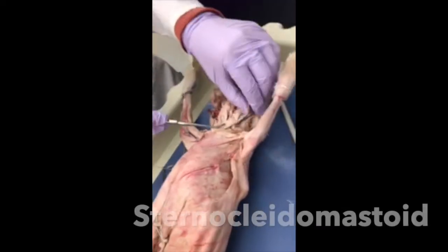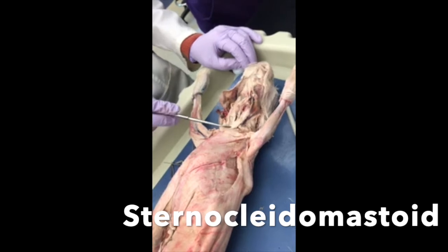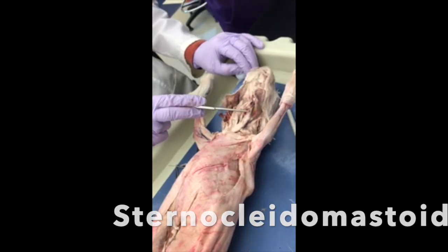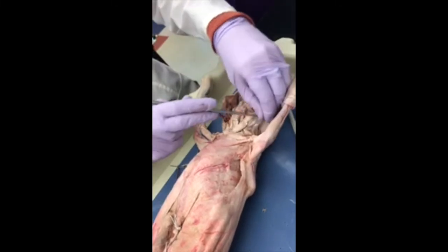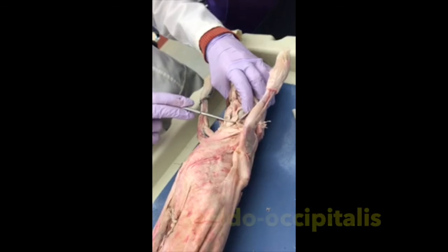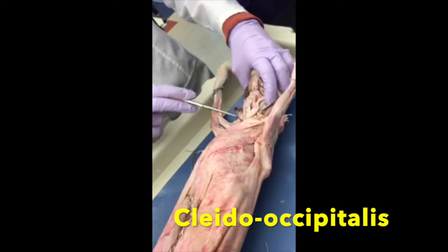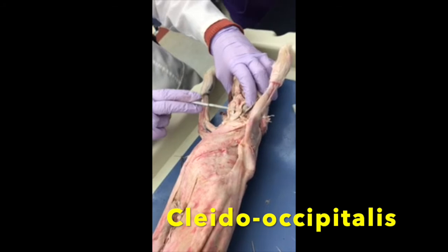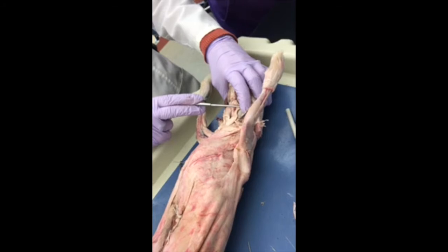Okay. This guy is the Sternocleidomastoid because it originates on the sternum and part of the clavicle, and it's going to the mastoid process in the back. So Sternocleidomastoid. The one on the side here, that guy, do you see that? Okay, that's the Cleido occipitalis because it's not on the sternum. Sternum's in the middle, right? It's on the clavicle. So it's Cleido occipitalis, so it's going further in the back of the skull, right? It's going all the way to the occipital condyles.